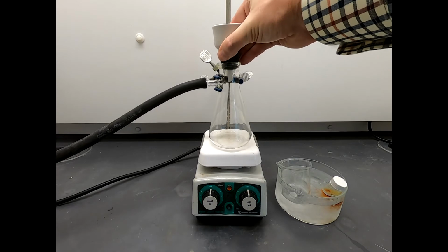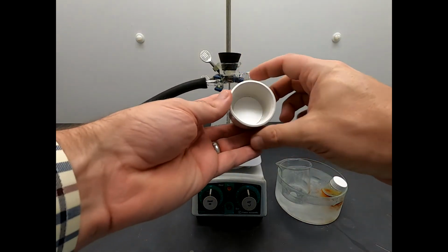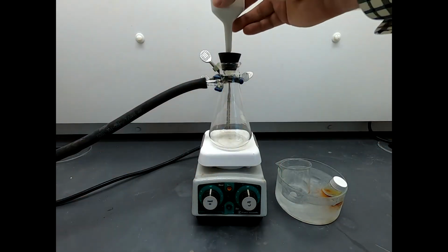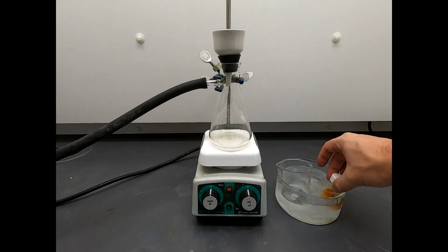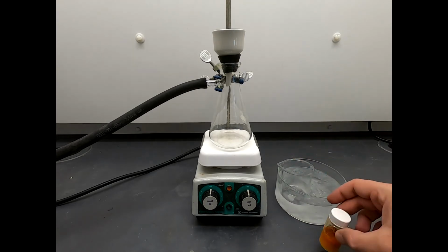Now it's not going to come out, but one thing you can see, there is a filter paper in there. We want to make sure the filter paper is placed so all the holes are covered. So we always have to seat the filter paper, and to seat the filter paper, we want to use whatever our primary solvent is that we're filtering. The reaction's been cooling on ice, and the reaction was run in methanol.